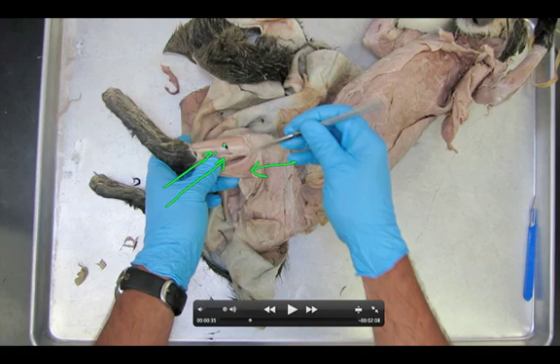Peroneus. And there will be a final muscle that we're going to see right here. You would think this entire thing is the tibialis anterior, but there's actually another muscle that's kind of hidden with them that we're going to have to expose. So let's watch how this unfolds — really quick dissection again.